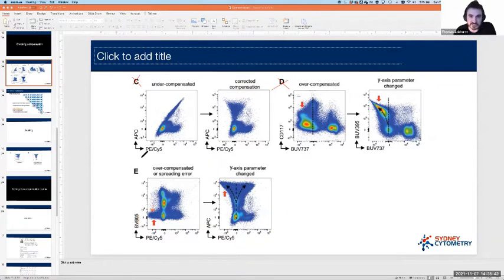It looks like that's just the plot we come across it in. If we change to APC, okay, that looks like APC is probably the culprit. This is not over or under compensation. This is spreading error, and this we can't do anything about. This is essentially that problem that we talked about.